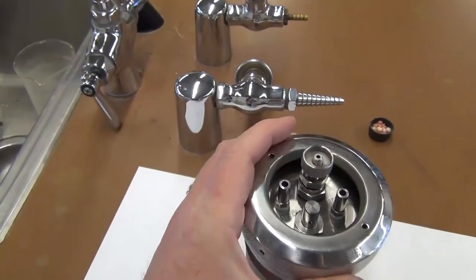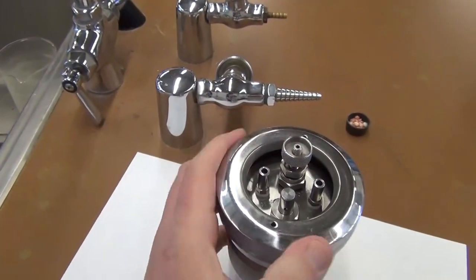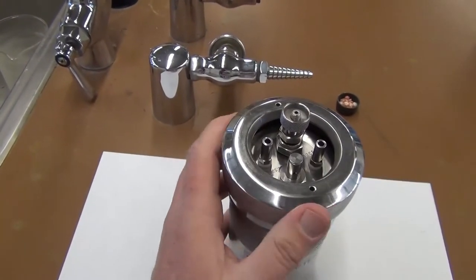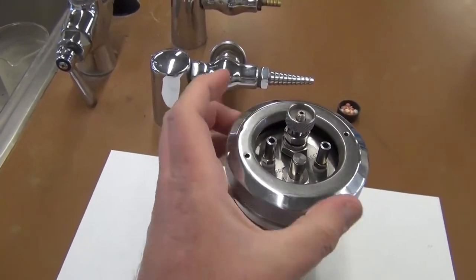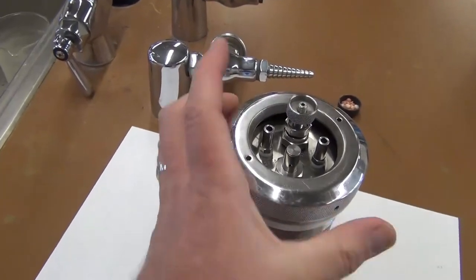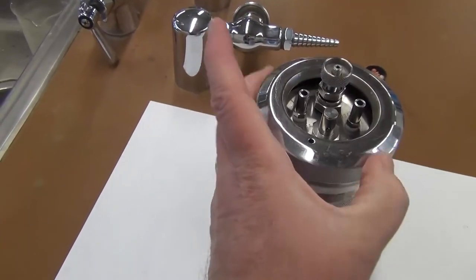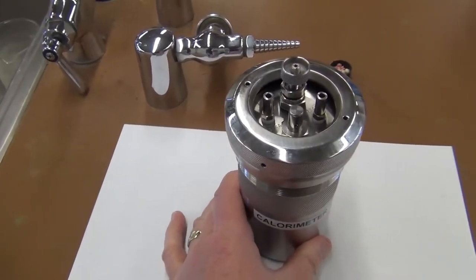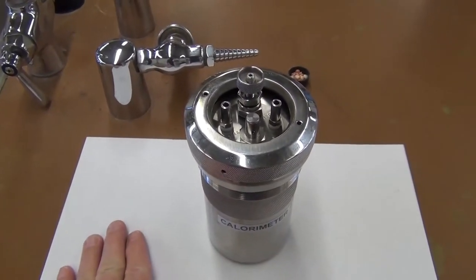Take the lid, screw it down until it's tight. Just snug, doesn't have to be 500 foot-pounds. Once snug, we're ready to go and put oxygen in it.